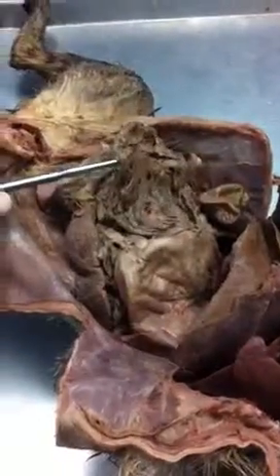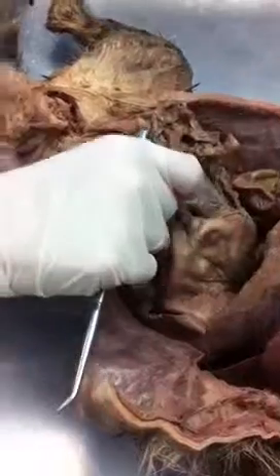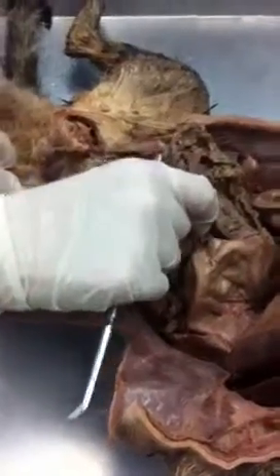intestines. And what's this called here? Greater omentum. Very good. What's this on the side? Spleen. What is the function of the spleen? Where the blood goes to die. Yeah, it's where red blood cells go to die. So that's the spleen right there. This right here. Okay. That's the spleen. It's on your left side.